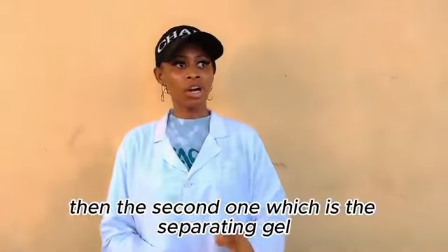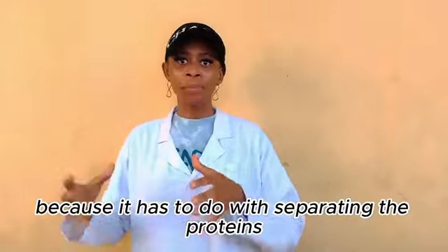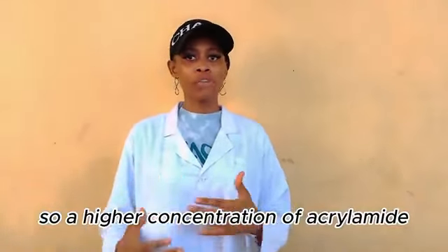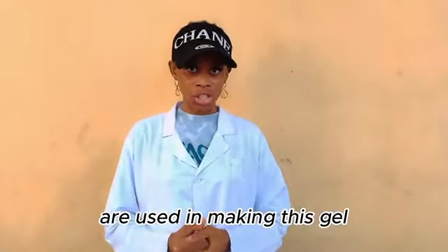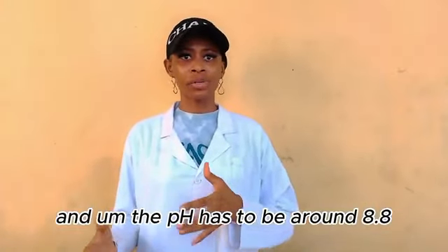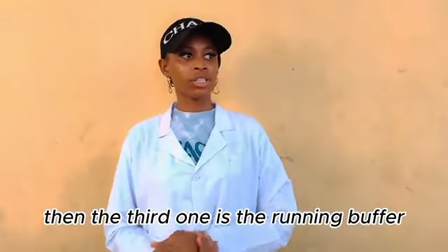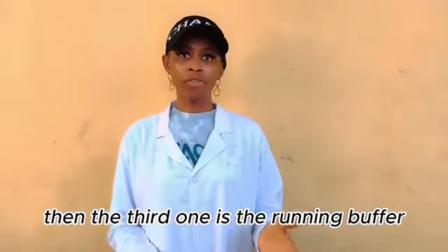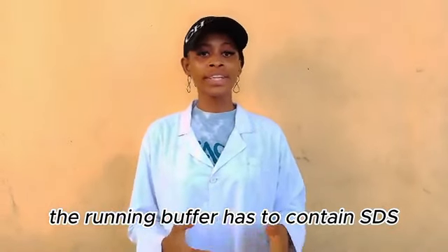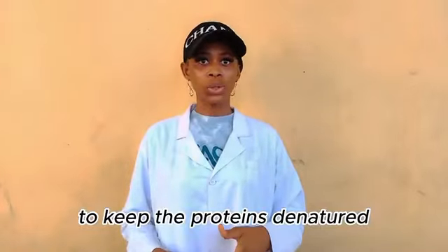Then the second one, which is the separating gel, the pores have to be very tight because it has to do with separating the proteins. So a higher concentration of acrylamide is used in making this gel, and the pH has to be around 8.8. Then the third one is the running buffer. The running buffer has to contain SDS to keep the proteins denatured.